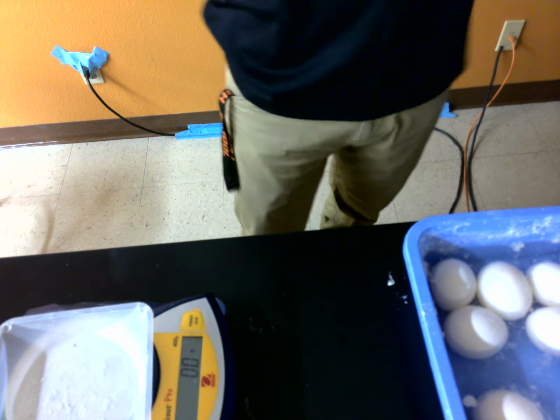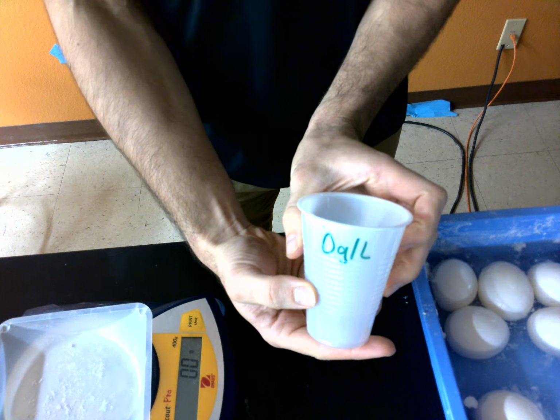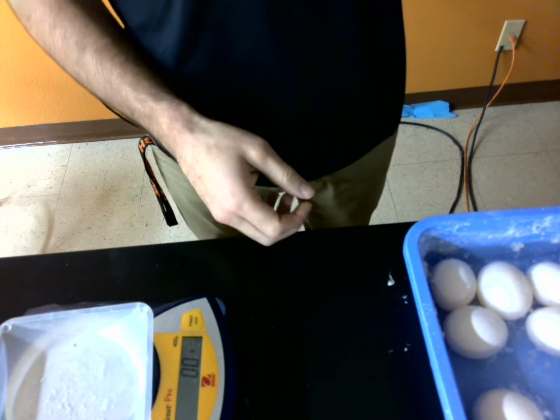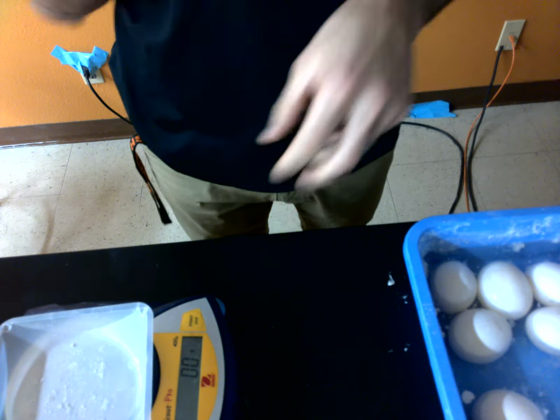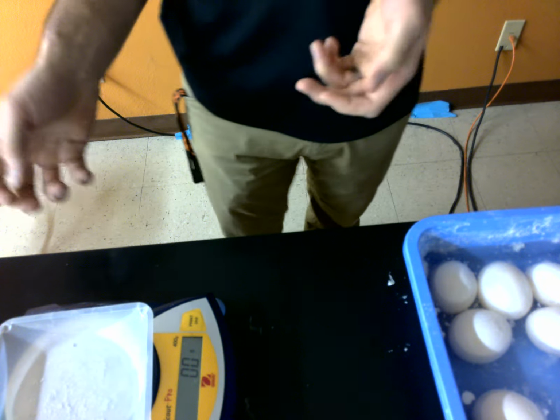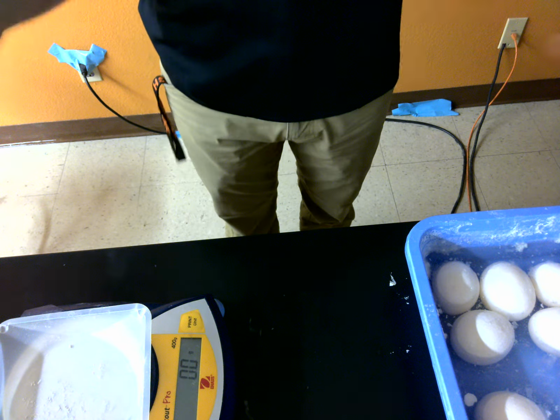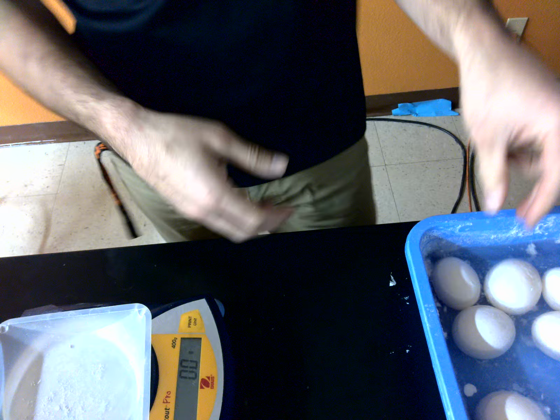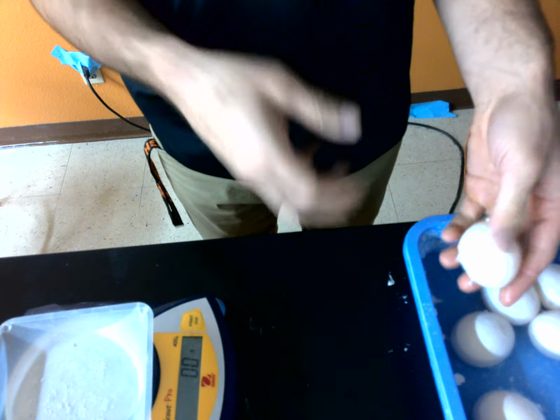Okay. And we're going to put these in these different cups, which I have labeled. This one is 0. And then we're going to take one of these eggs, which are in vinegar, take that out of the vinegar and put it in the solution. And so what we should see based on whether or not the solution is hypertonic or hypotonic, that's what you guys are going to figure out later. We're going to see the egg either shrink or grow due to osmosis, right? So the shell of the egg here will not allow the sugar to go through, but it will allow water to go through.